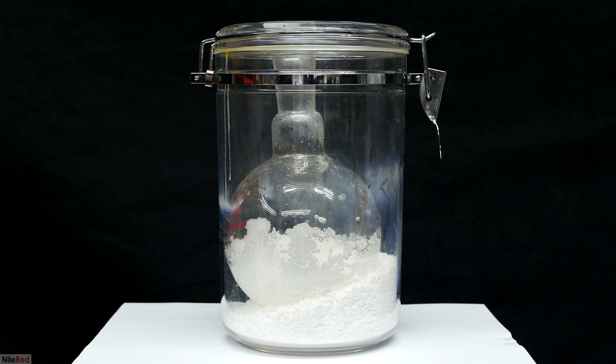Okay, now for something that I thought was pretty interesting. I pre-weighed the bowl, so immediately after taking it out of the desiccator, I weighed it again to get the mass of the trimethylamine hydrochloride. The initial shot of pouring it out was a little bit overexposed, so I decided to redo it. Once I got the shot, I transferred it to a pre-weighed airtight storage container, and I re-weighed the whole thing again. The initial mass that I weighed was 113 grams, but the second mass that I got was 120. In the one minute that it took to redo the shot and transfer it to the bottle, it apparently picked up about 7 grams of water.